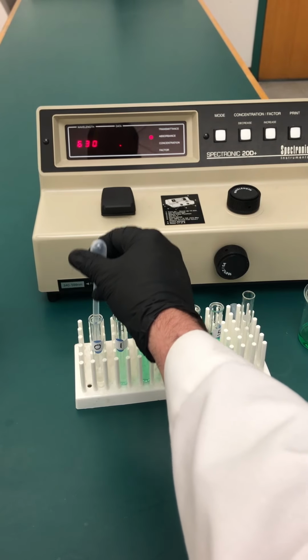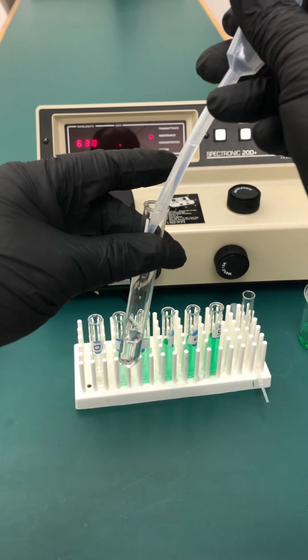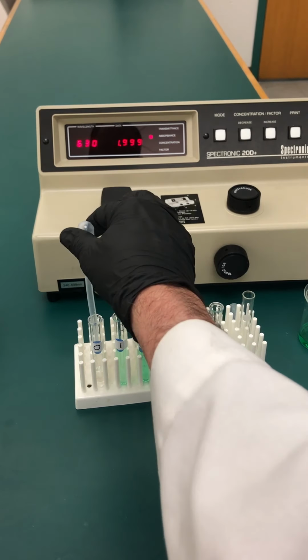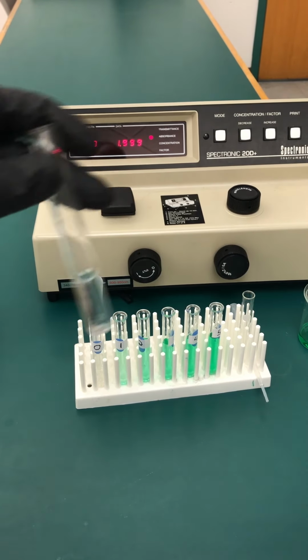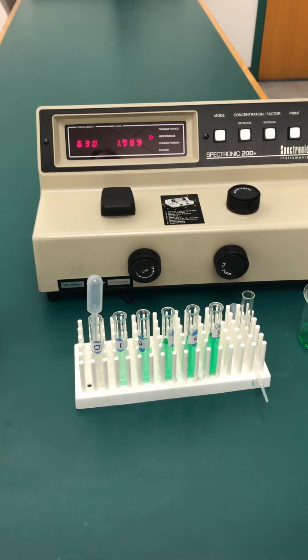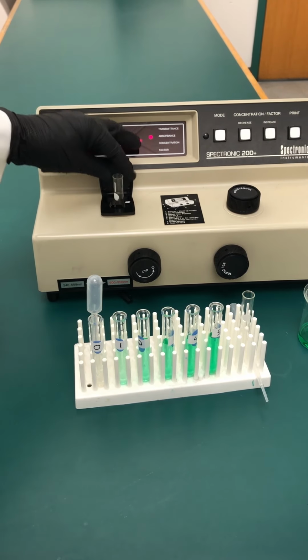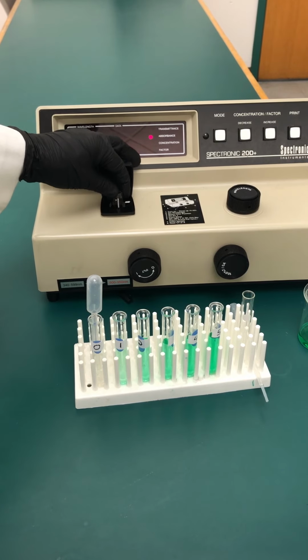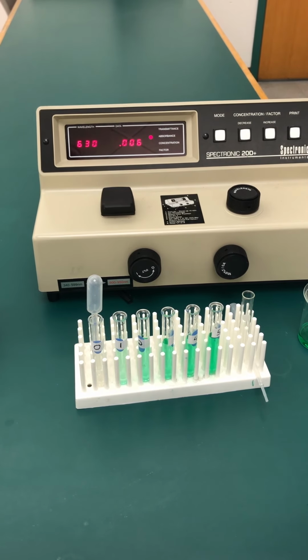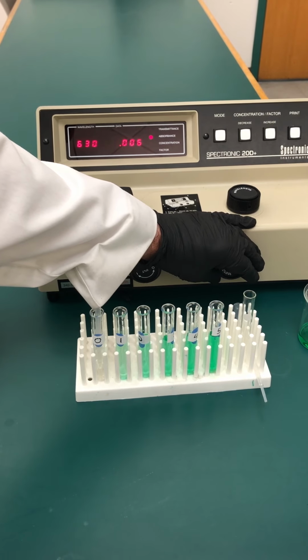So we're going to take a sample there with a clean dispenser pipette and put it in our cuvette. I should go to about 1/3 of the way up, right? I'm going to leave that dispenser pipette in there, and I'm going to put this in the chamber so I can recalibrate the spectrometer to 0. Make sure you line up the cuvette with the chamber's marking in there. You bring it down, and now, remember, we're going to use this knob over here to set it to 0.